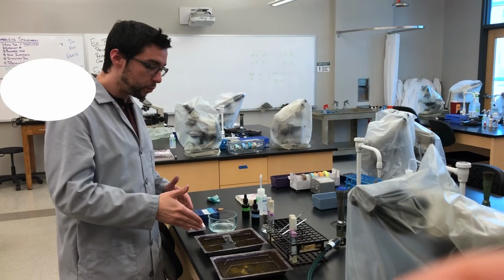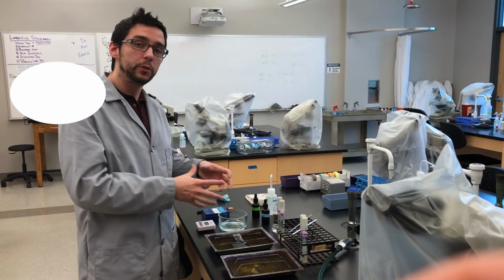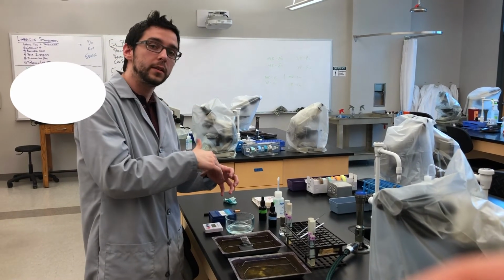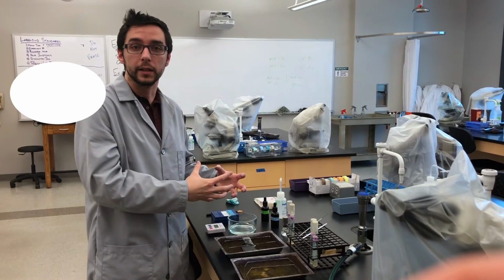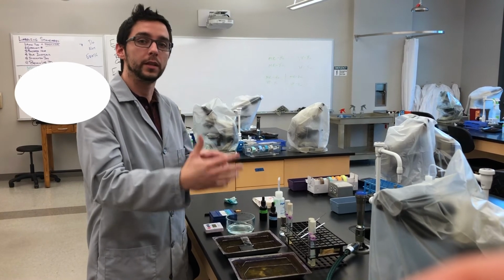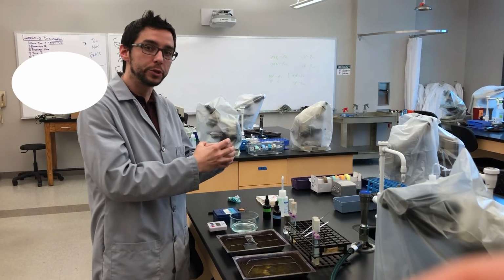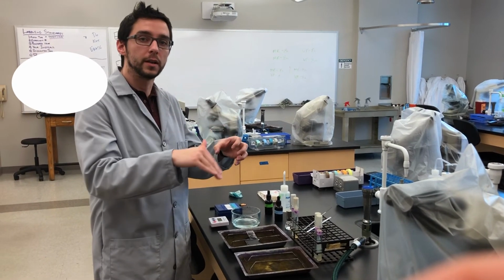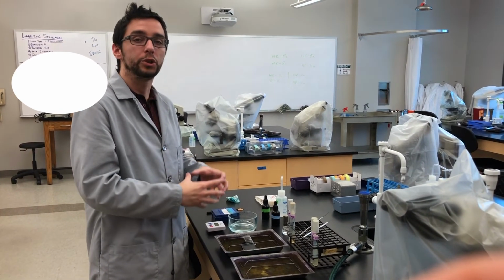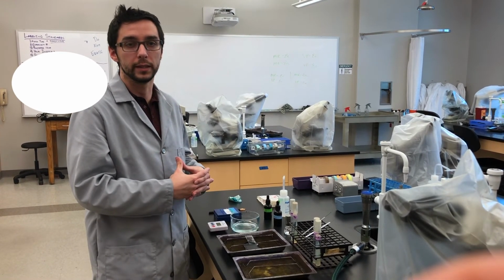So while we're waiting for this 1 minute with the safranin dye, let's just cover what you're going to see. If it is a fully formed endospore, you're only going to see green because the heat we applied to the malachite green drove that into the endospore structure, and so it'll show up green. If it is a bacteria that is in the process of forming the endospore, you will see both red and green. Why? The endospore structure itself will soak up the green, but all the other part of the cell will remain red, and then any cell that isn't forming an endospore will show up entirely red because there was no endospore to soak up the malachite green when we applied the heat.